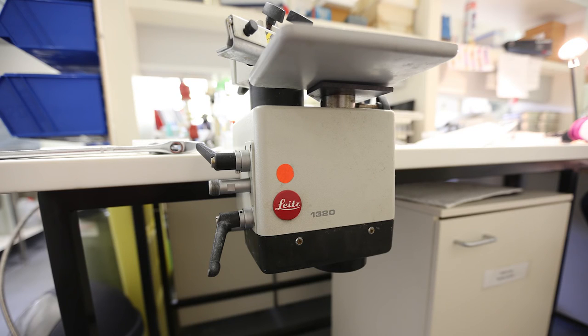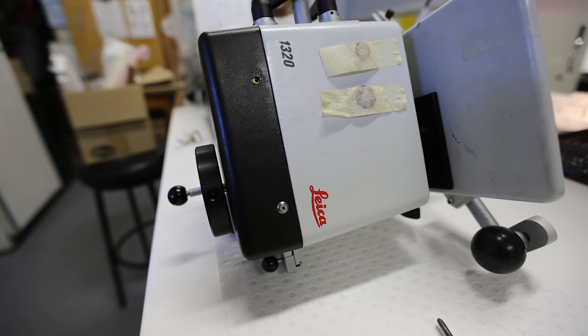So yeah, I made this video mainly just to show what's going on, to show the state of the machine. And if anyone had any suggestions as to what might be going wrong with this microtome, and more to the point, how to fix it, I would be forever grateful.